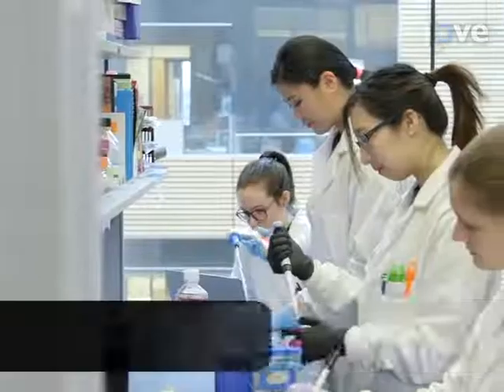Generally, individuals new to this method will find that optimizing the microscope settings for the simultaneous imaging of multiple fluorophores using STED will require some practice. Demonstrating this procedure, along with John and Madison, will be Kate Choi and Caitlin Pritchard.